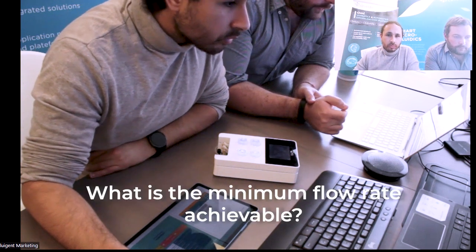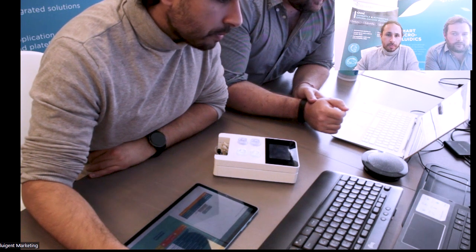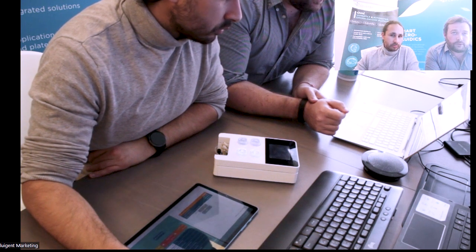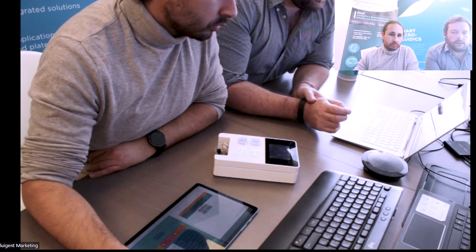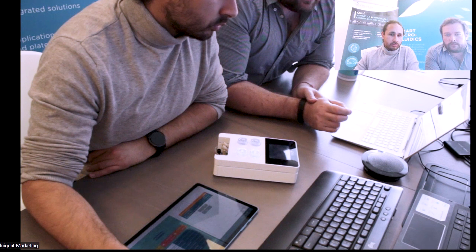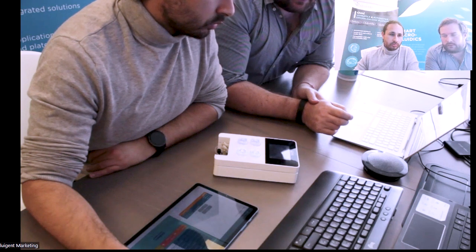The minimum flow rate achievable: the sensor itself is able to measure with a resolution of 0.1 microliter per minute. To have a very accurate measurement, we would recommend using around 5 microliter per minute.